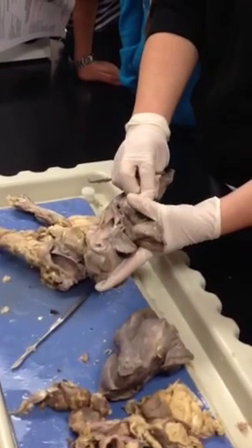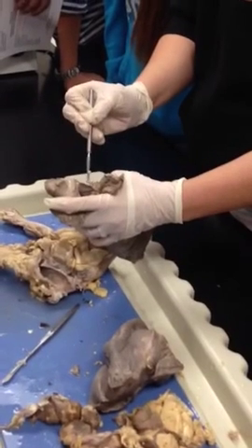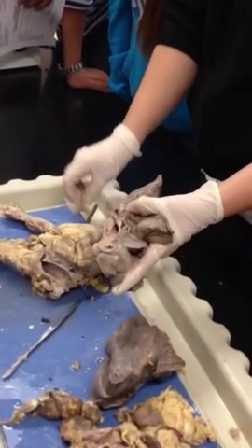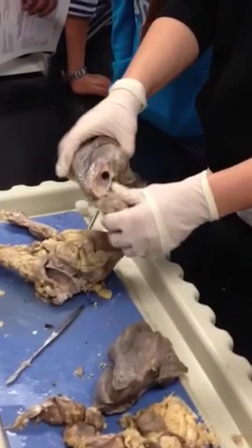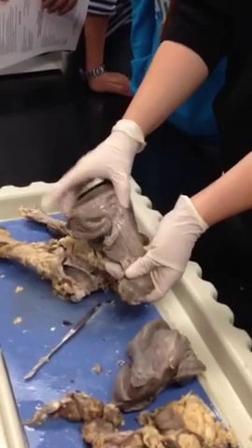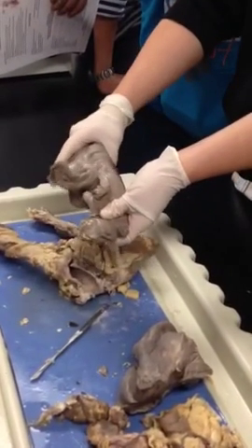When we're talking about the pulmonary vein, it's very flimsy, and the artery is thicker and harder. So I suggest that you guys at least put gloves on and play with the lungs and look at them. You can do them together, but you can definitely see the three lobes. You have your superior, you have your middle, and you have your inferior.